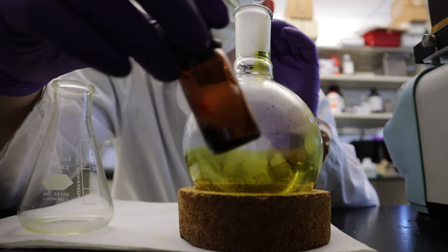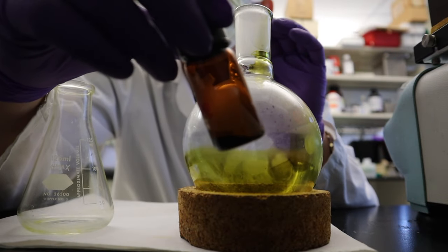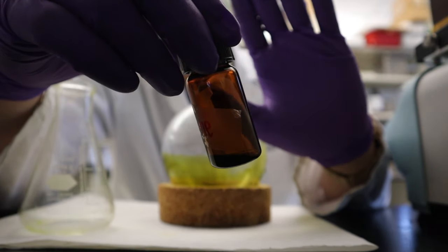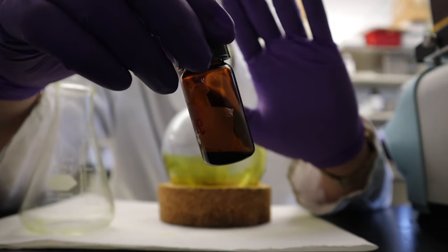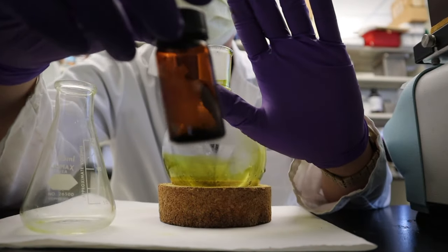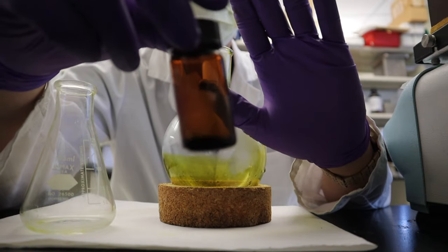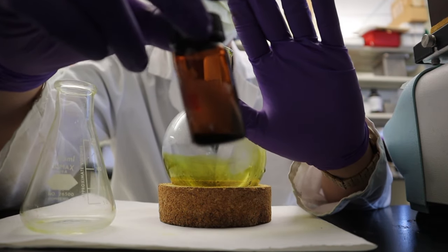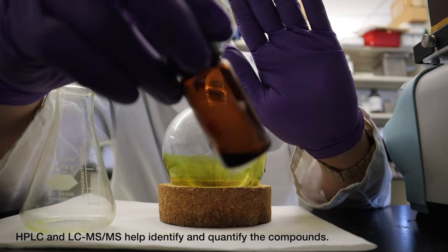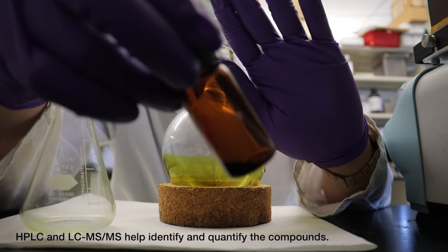After transferring, we will be putting this in the fume hood for further evaporation of the solvent. It will give us a very sticky plant extract. And we will be running it in HPLC and LC-MS-MS.